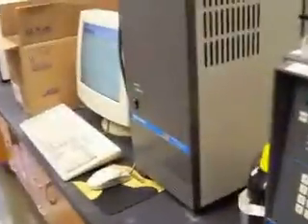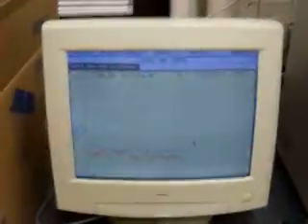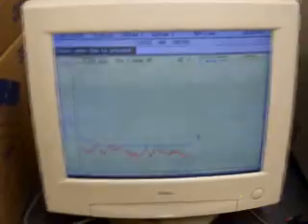For everyone at home, here's the Whitesides Group bio room, including a CE. That's a capillary electrophoresis instrument, and then another CE over here. It's actively collecting data as we speak. Oh, this is privileged information that you're collecting right now. Nice. And then yet another CE. Wow.